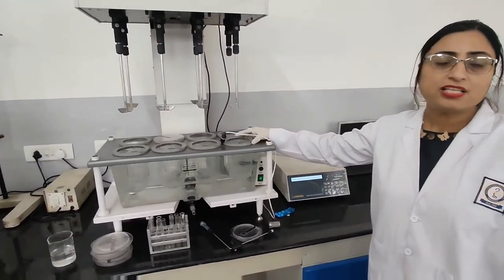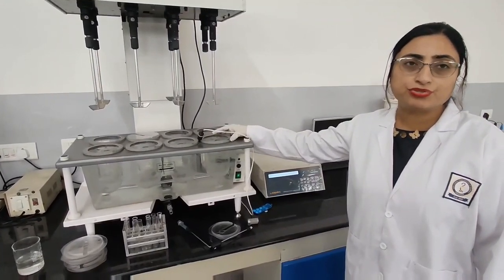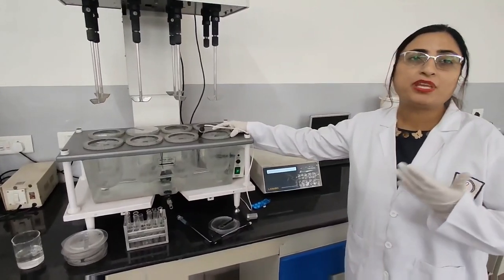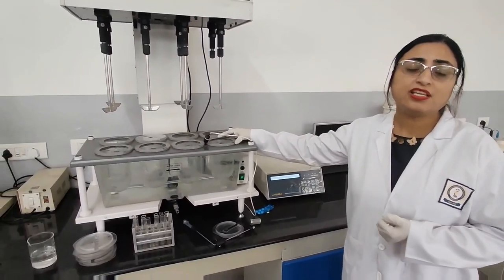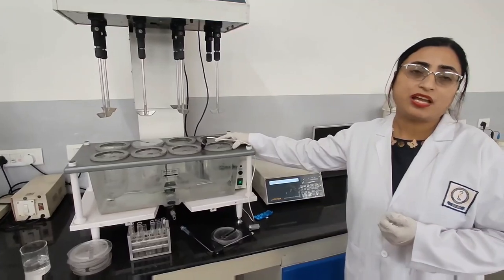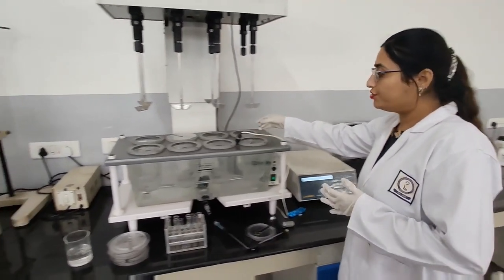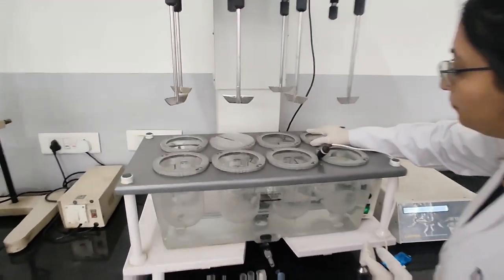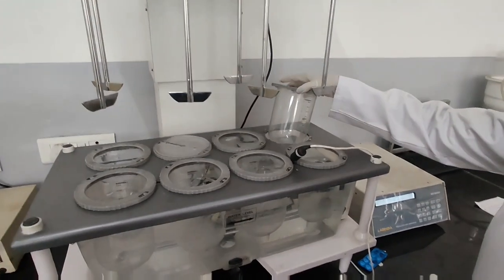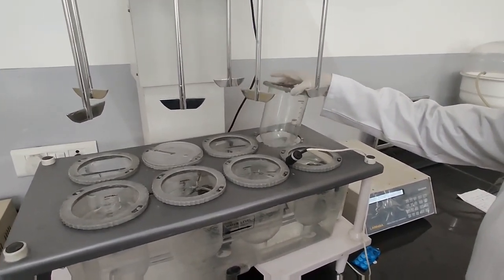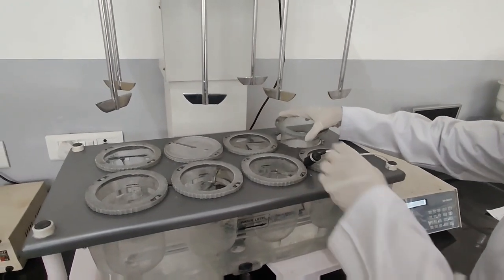First is this dissolution jar. These jars are detachable dissolution jars. Before performing any dissolution testing, we have to detach the jar and clean it properly. I will show you how. We have to detach the jar like this. We will clean it and then place it in its position.